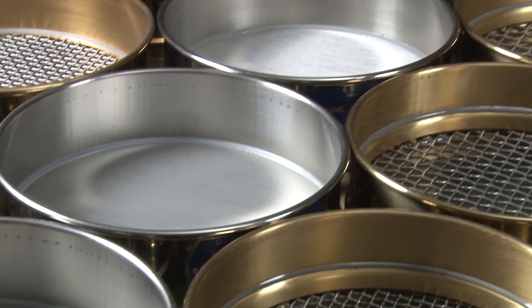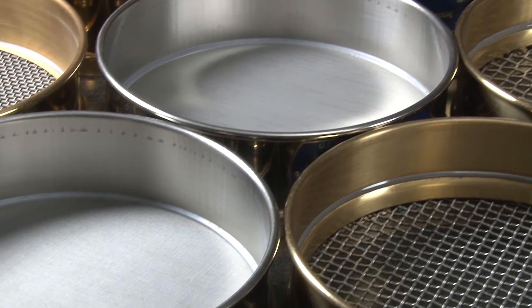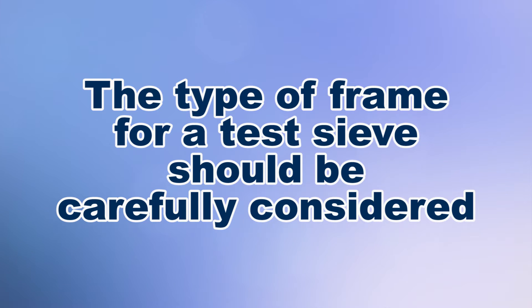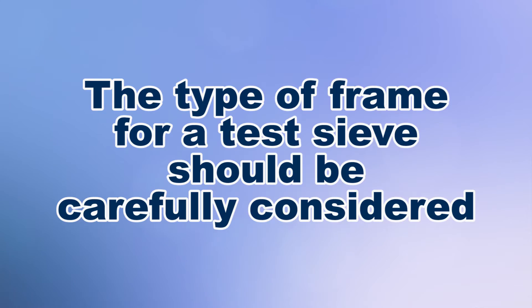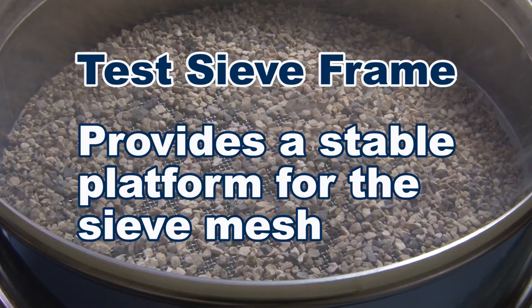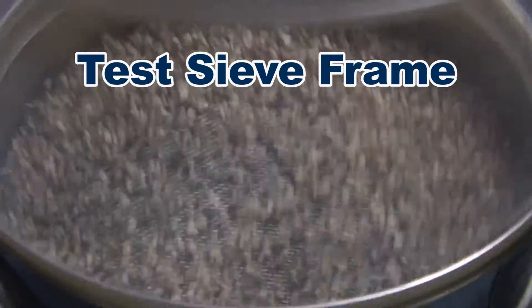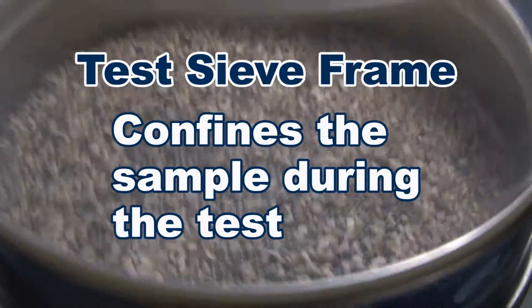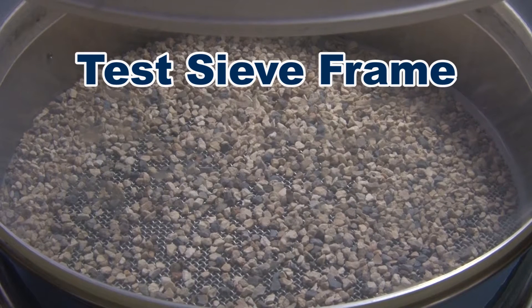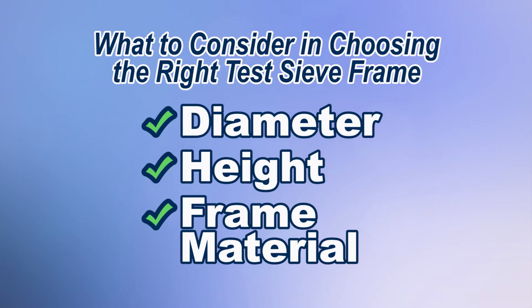Selecting a test sieve must be based on test specifications, material size, and sample volume. Consequently, the test sieve's frame should be carefully considered. Test sieve frames provide a stable platform for proper mounting and tensioning of the sieve mesh, and the test sieve frame confines the sample during the sieve analysis test.